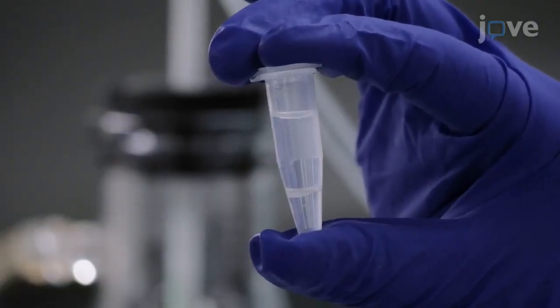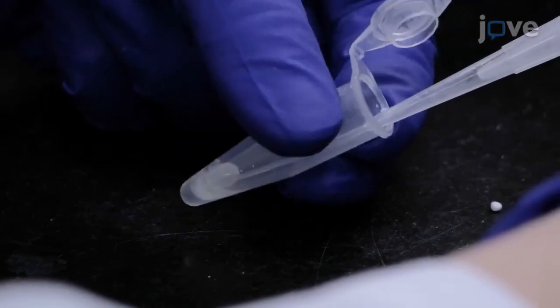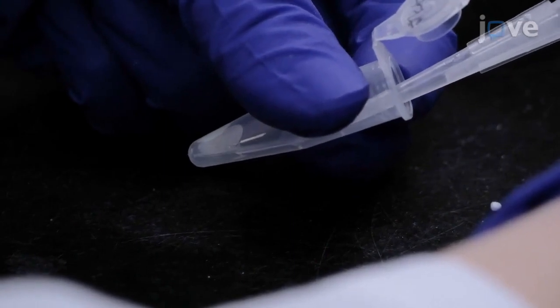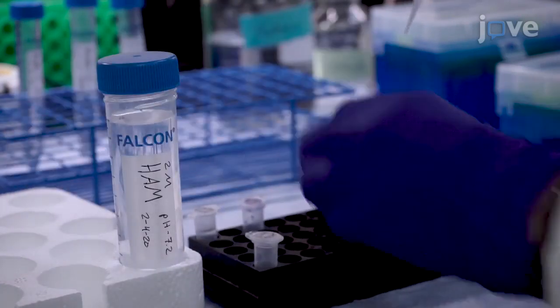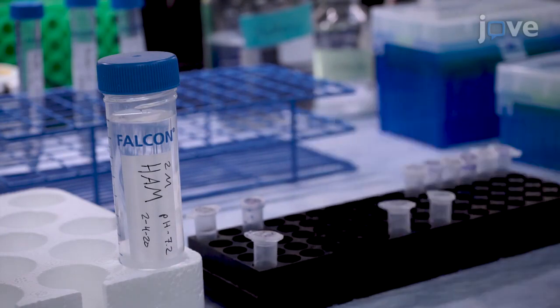S-Acylation can regulate a variety of cellular processes such as protein trafficking, plasma membrane targeting, signal transduction, ion transport, and protein-protein interactions. It is important to use freshly prepared hydroxylamine solution with carefully adjusted pH for each experiment to ensure an efficient and specific cleavage of the thioester bond.